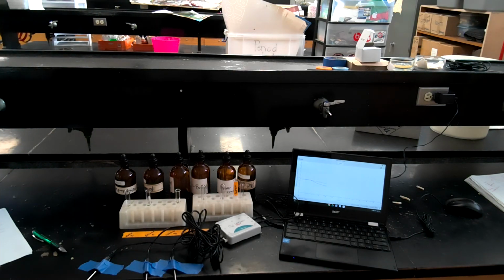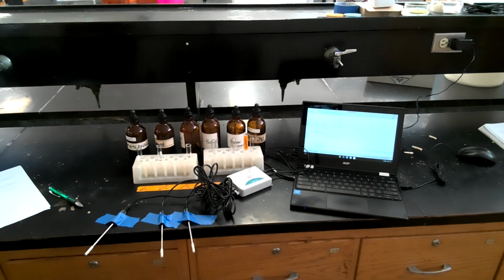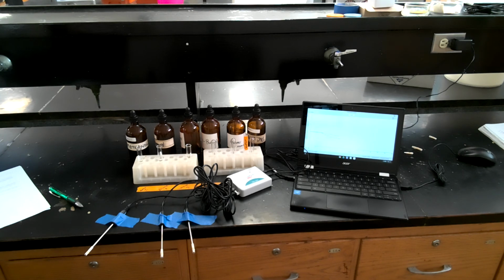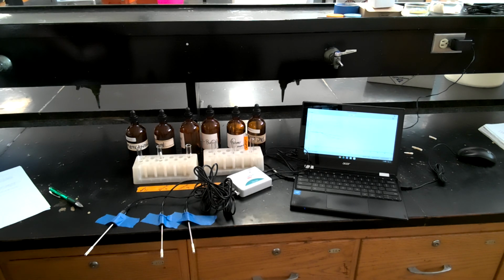Okay, so let me move this down just a bit. Okay, so that's how my probes are right now. I'm already starting to see a good little dip there with all 3. So this is going to run its course of 4 minutes. After 4 minutes, I'll come back and show you guys what it looked like, and then I'll run the other 3, and then we'll talk about the graphs afterwards.